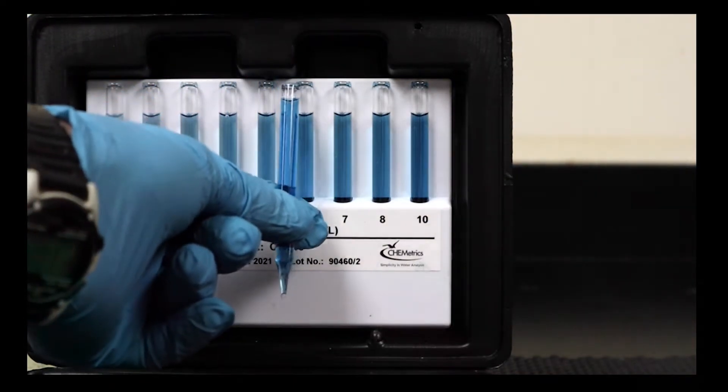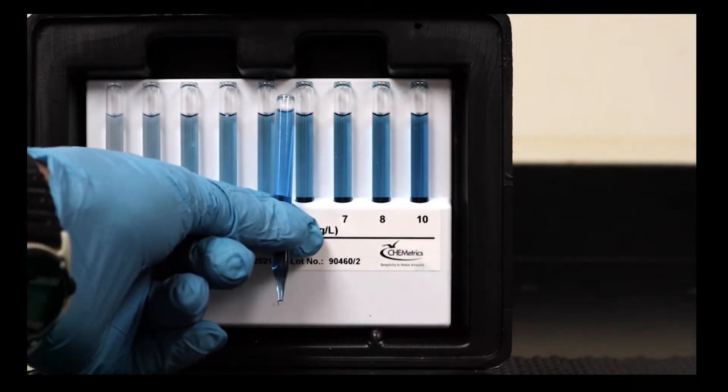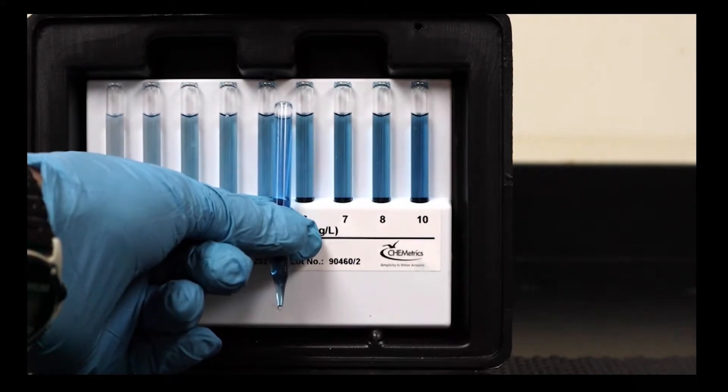We're right around two minutes. I'd say it's a bit darker than the one to the left.